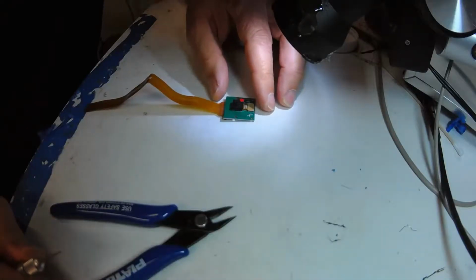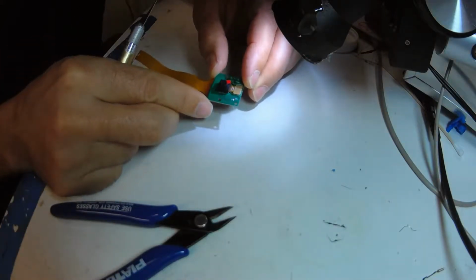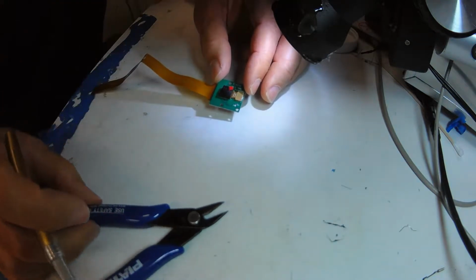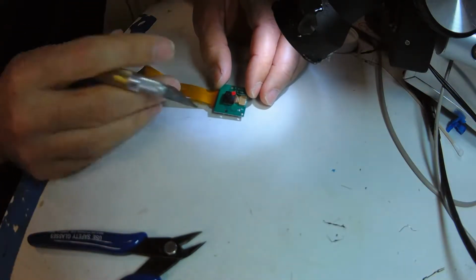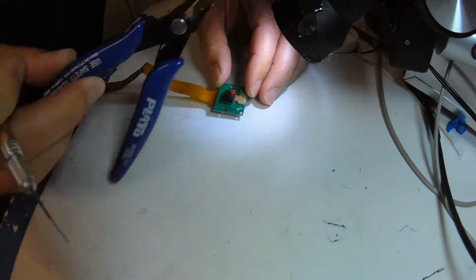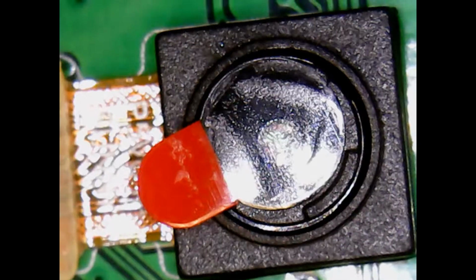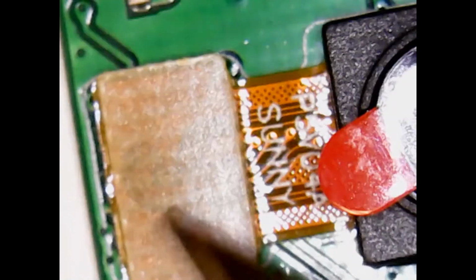How to remove the lens of a Pi version 1 camera. So first thing you'll notice, I'm doing this under a stereo microscope. It seems to help me, so I'd advise that. I have diagonal cutters and an X-Acto blade. So the first thing, notice this connector and the camera's loose.